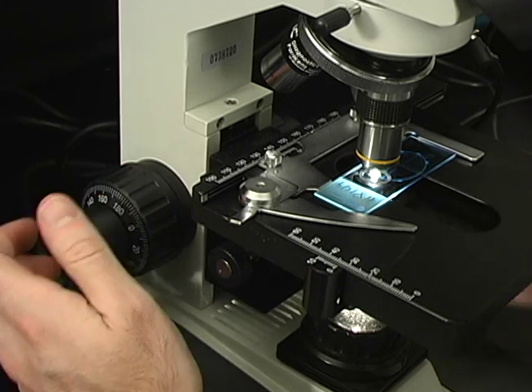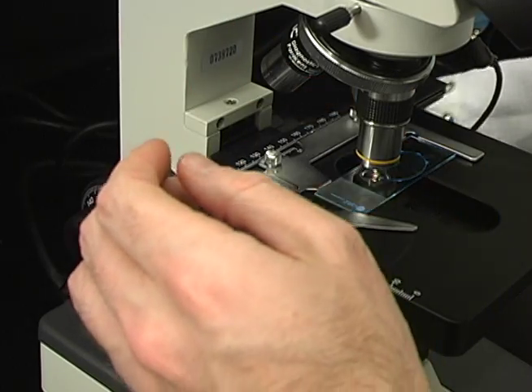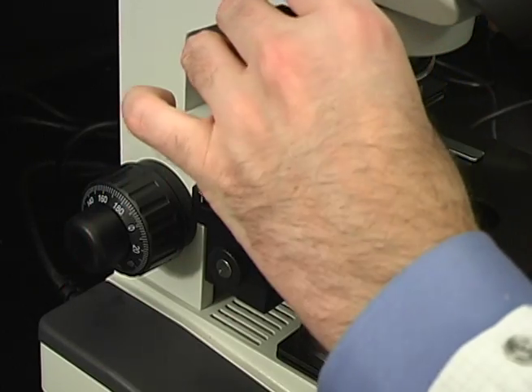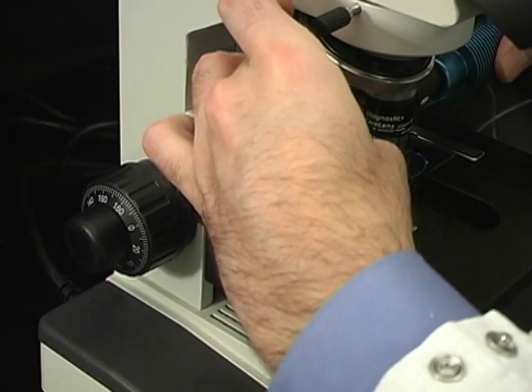When viewing slides with the Paralens, first focus with a lower-powered objective. Once the object is in focus, turn on the Paralens.